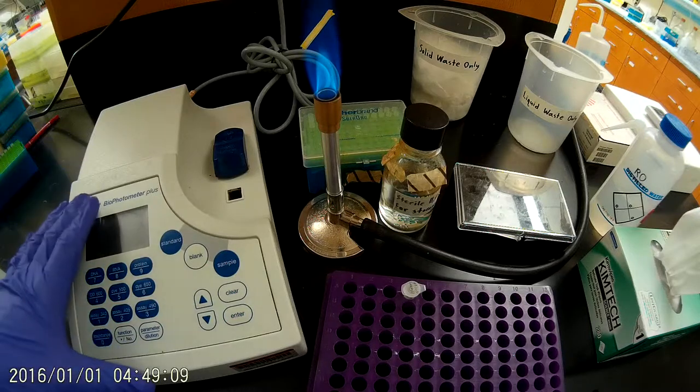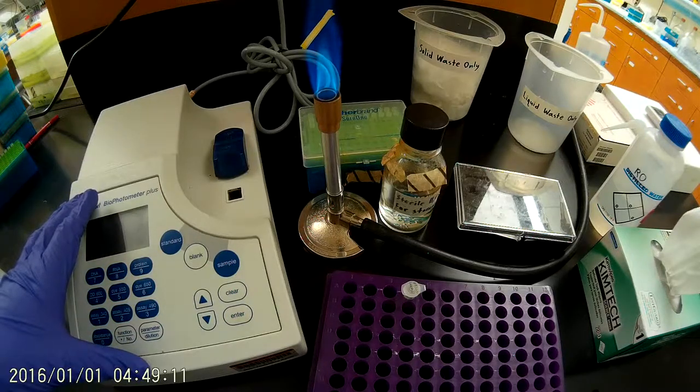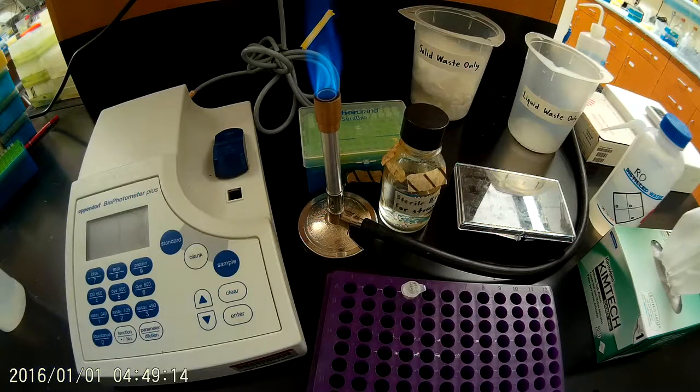In our lab we use an Eppendorf biophotometer for this because it's simple, easy, and doesn't require the preparation of standard curves to get reasonably accurate results.